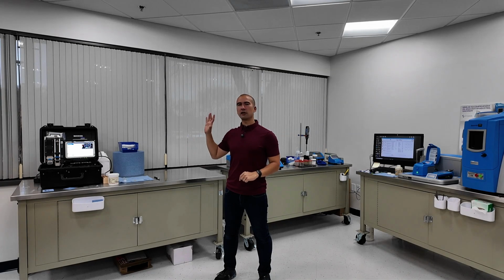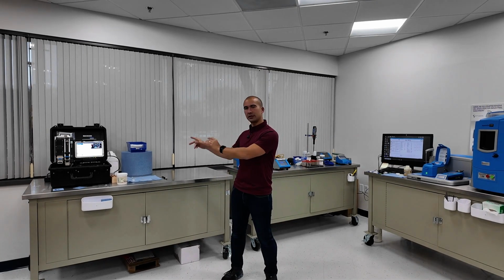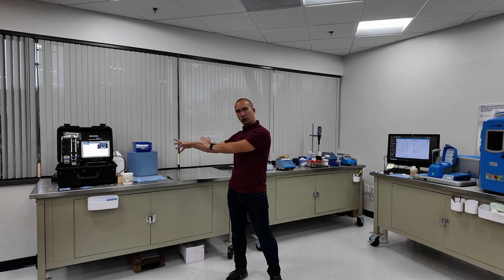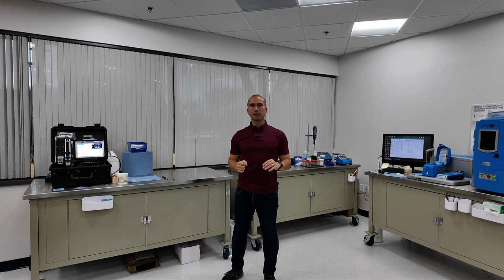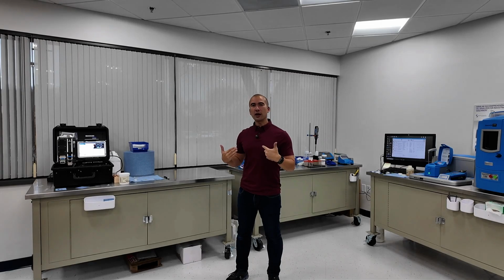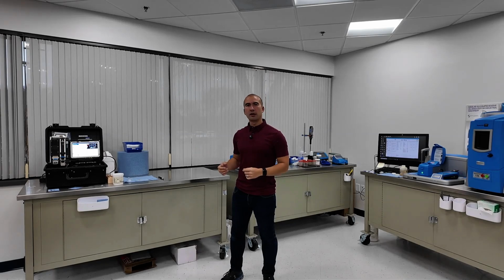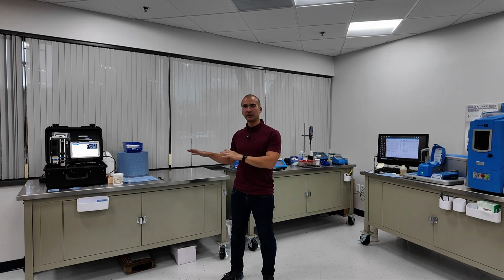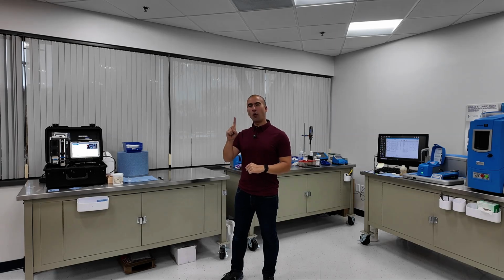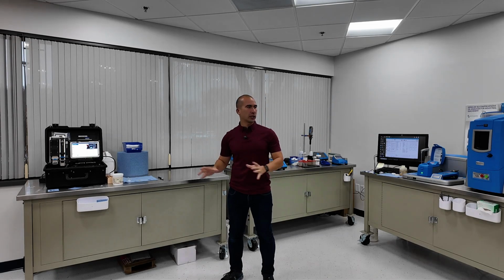And hopefully you've got an idea of FieldLab versus MiniLab: very much something that can be taken out around the equipment, versus if you have an actual lab setup. So hopefully, just in doing this demonstration, what we've shown is these are pretty much idiot-proof. That was actually my first time ever running any of those analyses. I've seen it done once, but that was it. So I'm just fumbling together, following instructions.